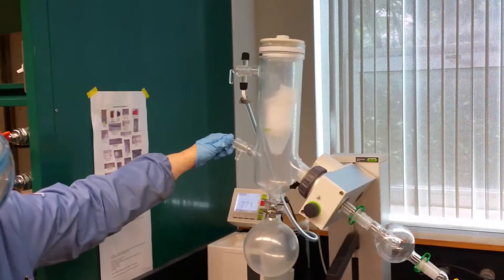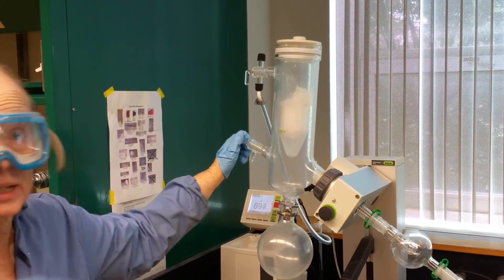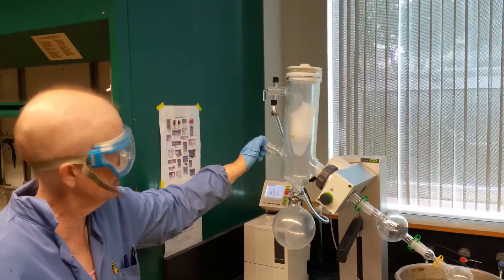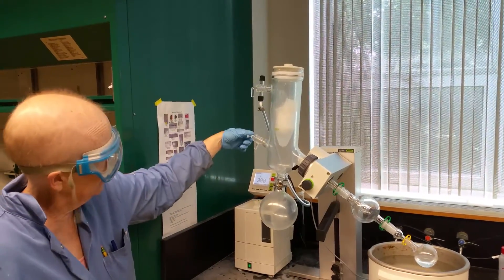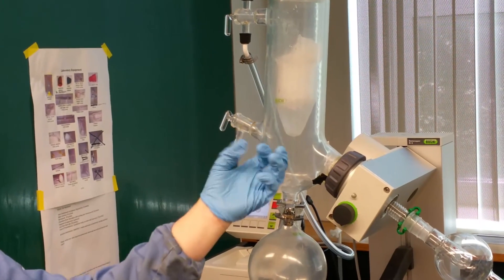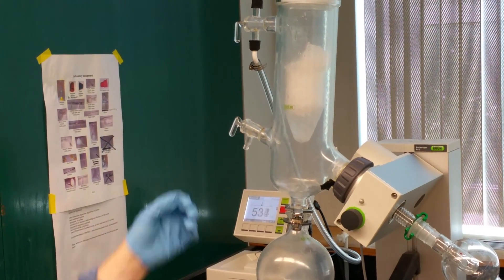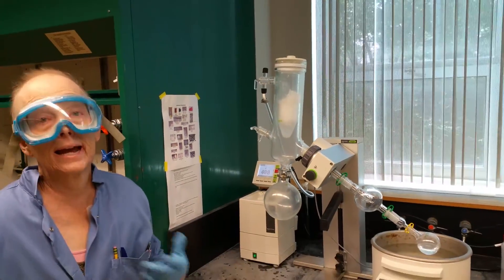Now, to get things going, this stopcock will normally be in a down position when you get on. Don't play with this. This is the stopcock you'll turn. I'm going to turn this 90 degrees. When I do that, I have closed it off to the atmosphere. When it's like this, you'll hear a hissing sound. It's sucking air in, and the pressure isn't very low. When I close this, the pressure's going to pump way down.